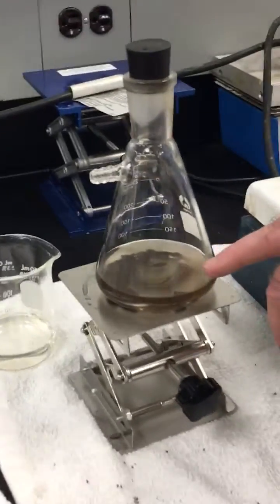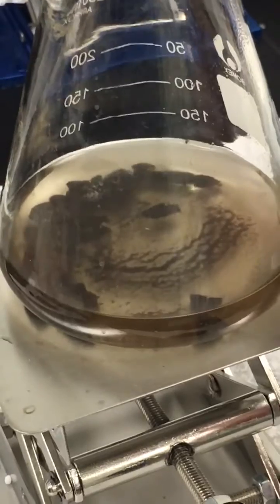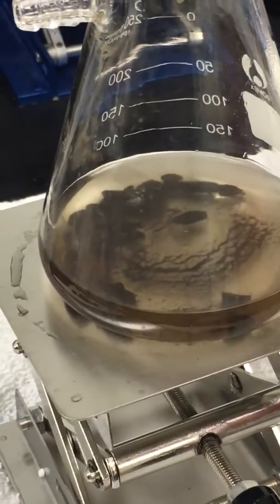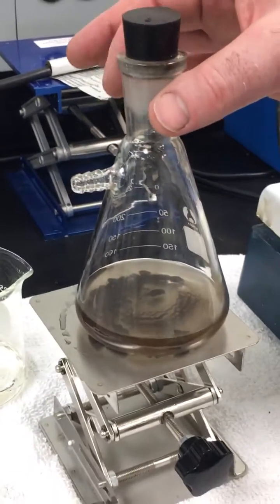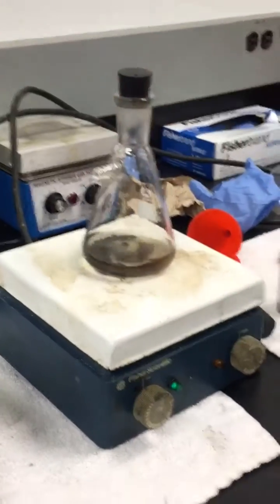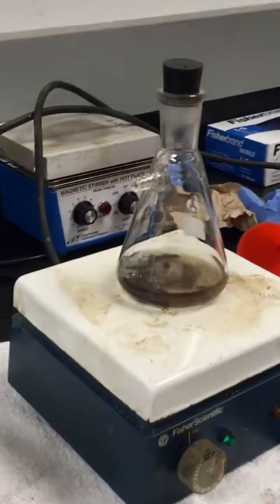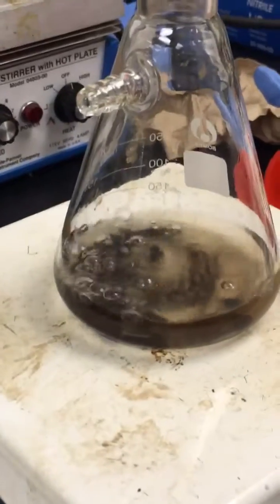If you look closely through the liquid catalyst, you'll see submicron particles that were on the surface of the rock — the dust — being drawn off. The bubbles have now stopped. Putting it back onto the hot plate, within less than 10 seconds it's vigorously removing gas again.